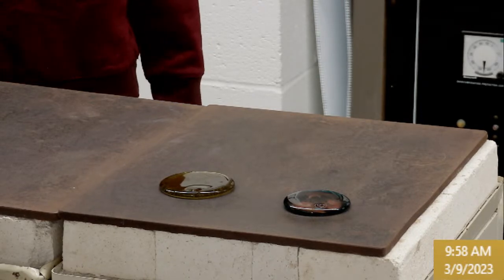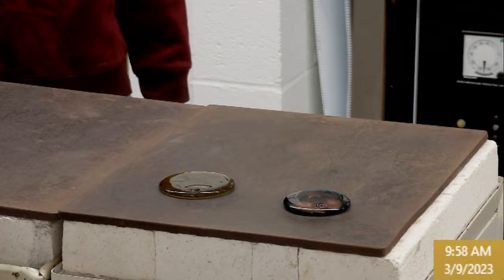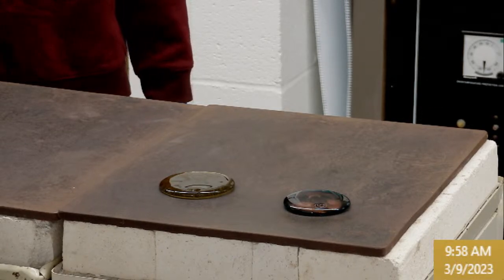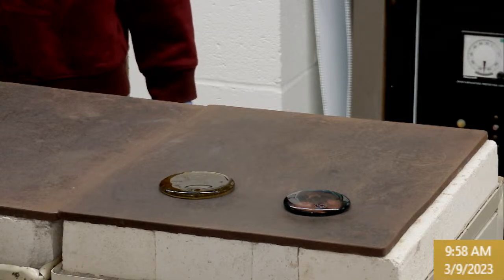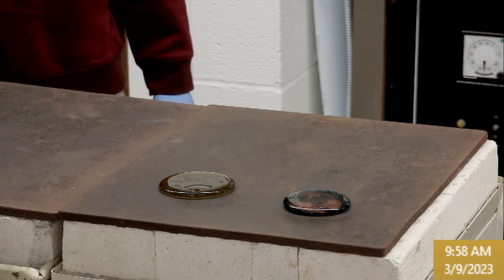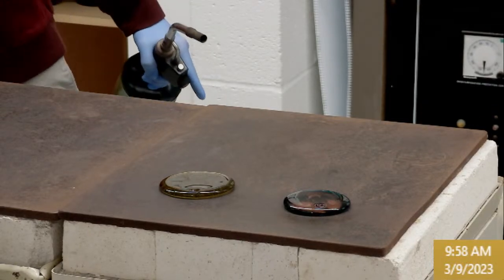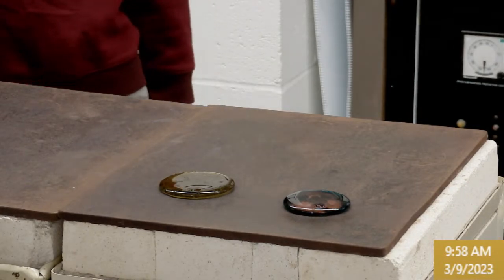So 3M is a lot of stuff again. That's Lake Michigan sand, sodium carbonate washing soda, crushed limestone. So half pure, half unpure calcium carbonate, and 0.5 copper. So that's going to be a fairly high load of copper. I mean, I guess we've gone up to 2 before, and so this isn't like crazy high, but it'll be a darker blue than the others.